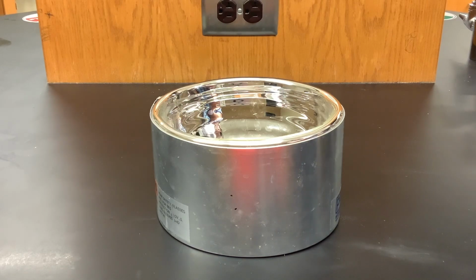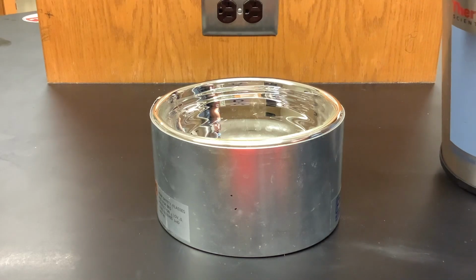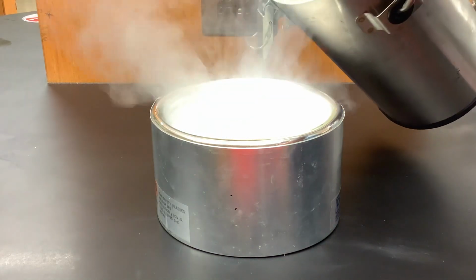So I have a metallic dewar here. This is just going to hold the liquid nitrogen. I'm going to pour it into the dewar. And because the dewar itself is at room temperature, it's much, much hotter than the liquid nitrogen I'm pouring into it. So at first it's going to boil very vigorously because the liquid nitrogen is going to evaporate. But eventually, once it gets cold enough, it will be able to contain it inside of this vacuum sealed chamber.